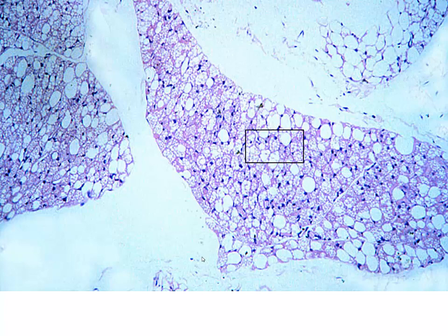All right, changing gears a little bit. We've been looking at a lot of our collagenous connective tissue. Now we're going to be looking at other types. We've got a lot of fat here, and this is going to be a place where we're going to distinguish the unilocular from the multilocular adipose tissue. We'll be able to see these tied together in the same place.